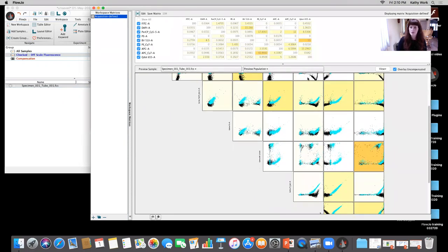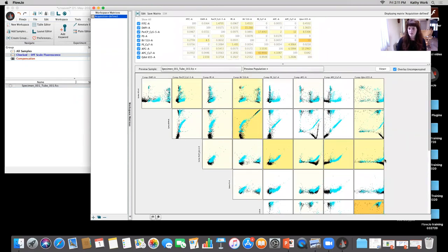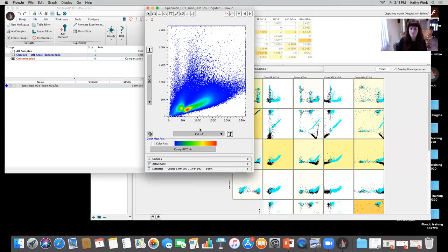So what I see is overcomp, and I also very clearly see off-scale data, okay? That off-scale data is actually causing incorrect compensation and is causing extreme negatives in multiple detectors, not that you would necessarily expect. Okay, so this is a BV650, and you can see right here, because it says Comp-Qdot 655, they just didn't rename the detector, the parameter. So if I double click and I open that up, I'll make this a little bit bigger.